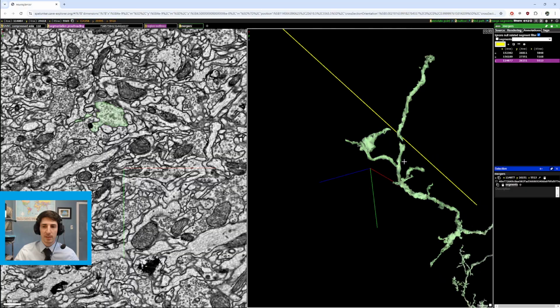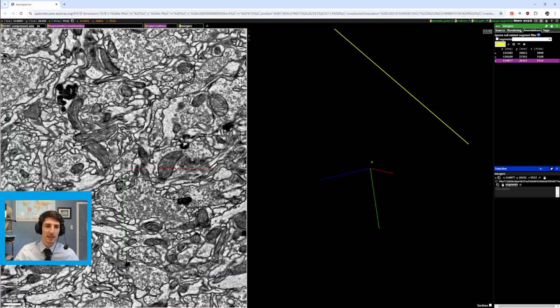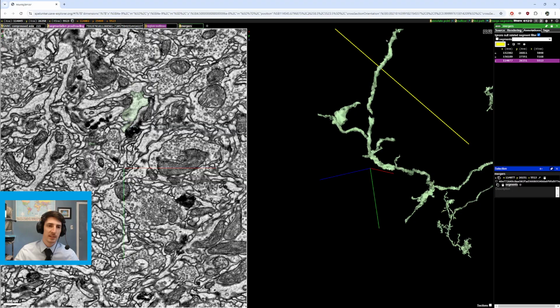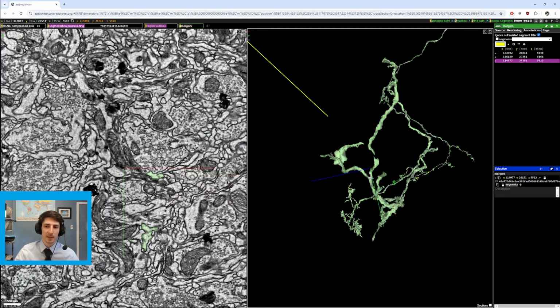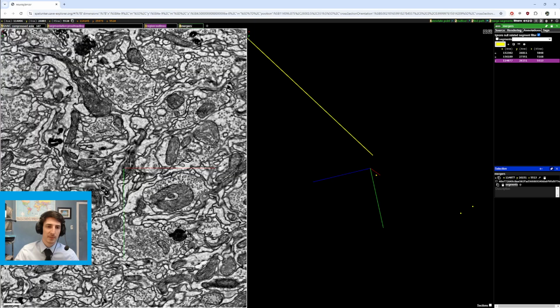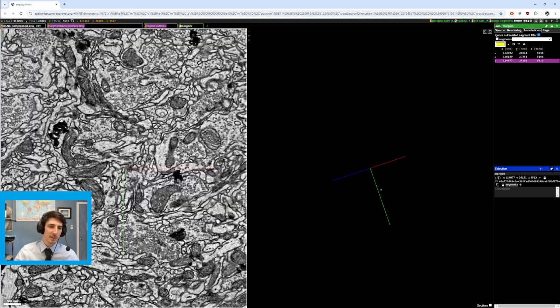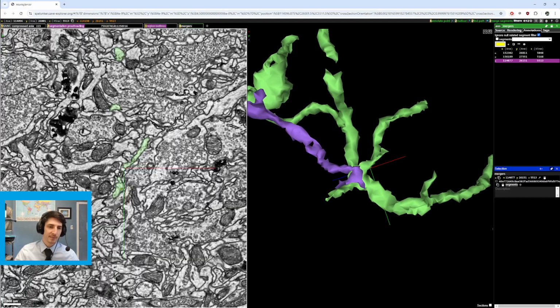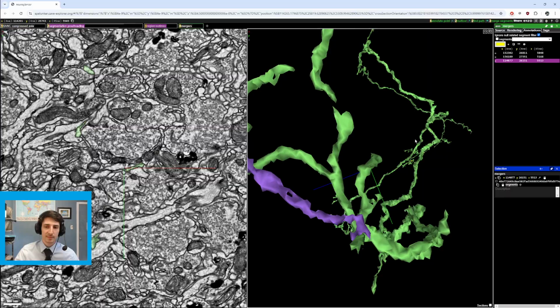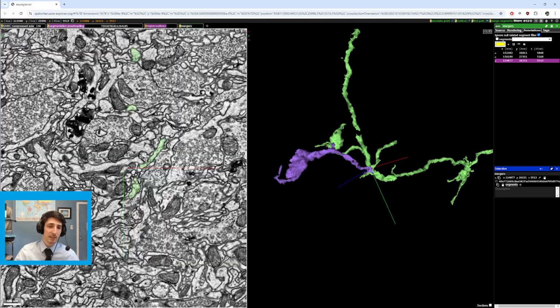and we trace all the way over to there, and we're tracing it back, and then it starts to get a little tricky, right? So this path seems all well and good, but when we look at this path, we see a different story. So this neuron connects over here, right? And that is an indication of a merger.